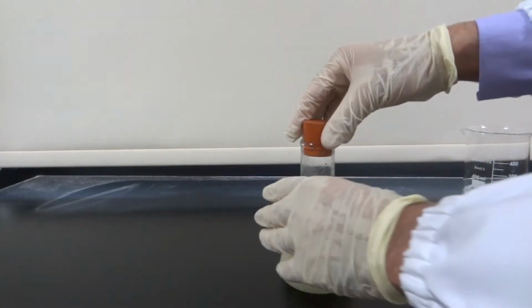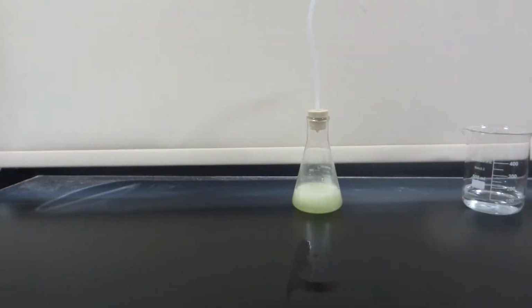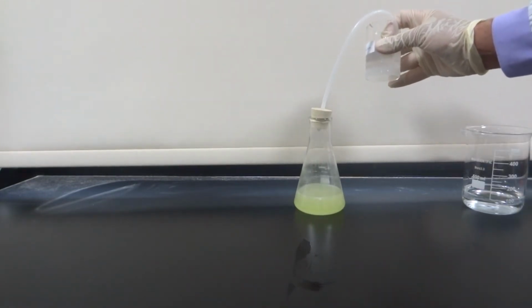The narrow neck of the conical flask is helpful when you need to collect the gas released by a chemical reaction. So, you can use a stopper with a delivery tube. In this experiment, the scientist is testing the kind of the gas released.